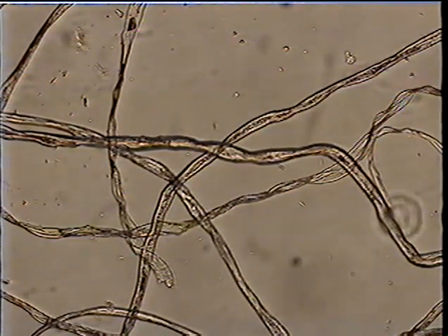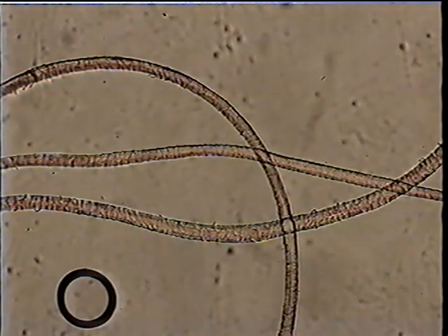There are many natural fibers, all of them identified by what you see looking at them microscopically. The next ones that we look at are wool. All animal hairs have scales, and you can see the scales very nicely on sheep's wool here. Even our hair, human hair, has scales. After all, we're animals. And the ones that we see here are my hair.